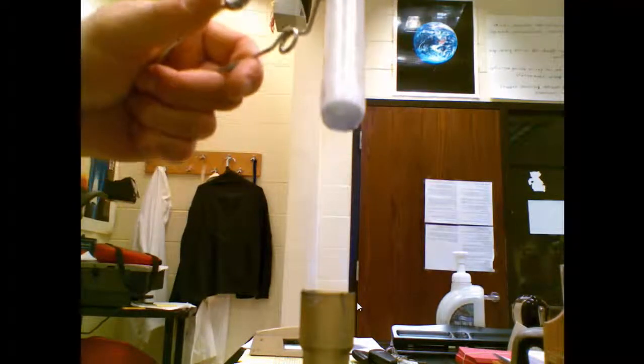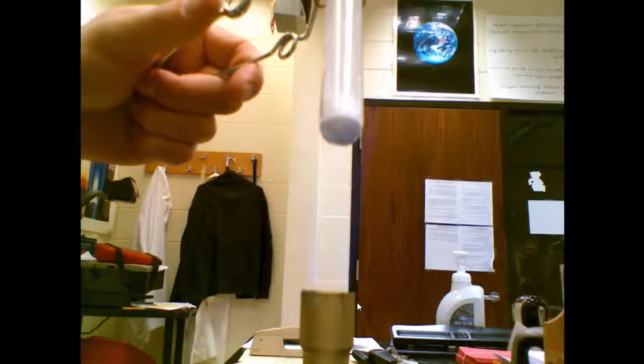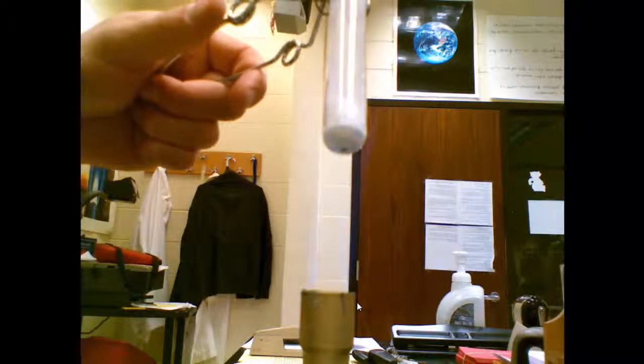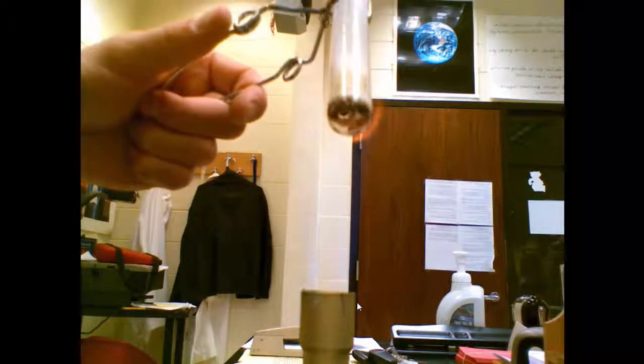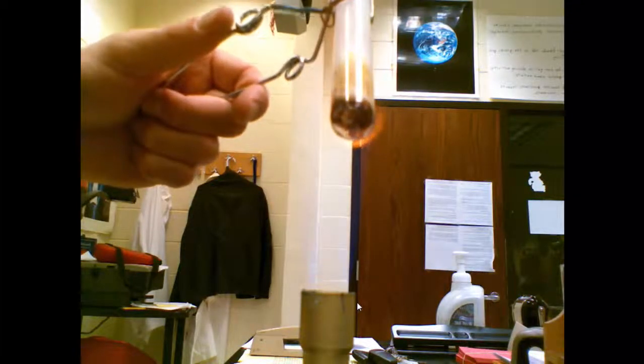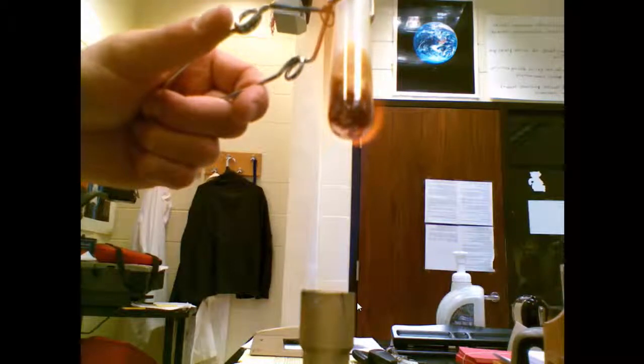This is crystal five. It's a white fine powder. Okay, it hasn't started to melt. Okay, now it's starting to do something. That's before the flame started to turn yellow. Just before it started to turn yellow, crystal number five started to melt.